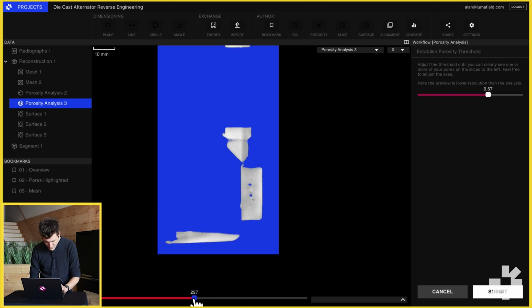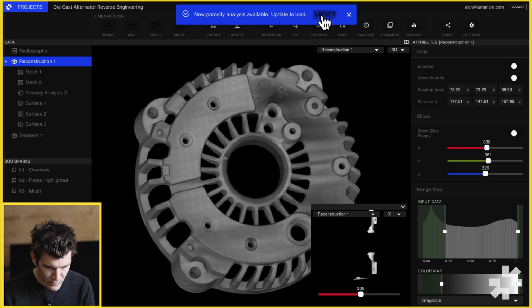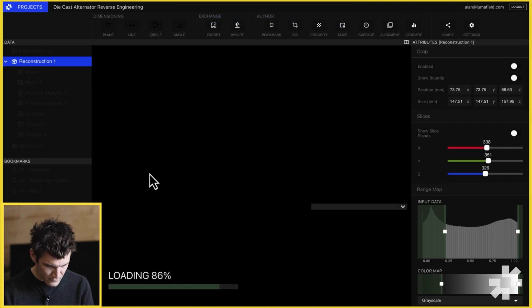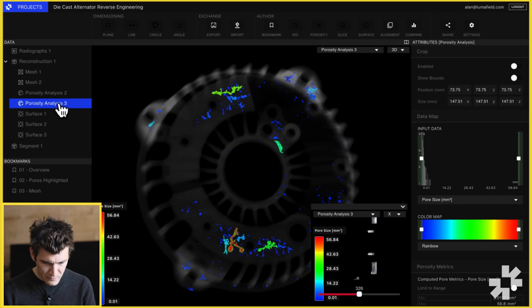Just take a look elsewhere in the casting. You can see that other pores are getting highlighted here. Once we're happy with our segmentation threshold, we can click Submit to send the porosity analysis job to the Lumafield cloud. Once it's finished computing, it'll update automatically in Voyager, and we'll be able to look at the results. So I'm just going to click Update here to load those new porosity results. And now we have our porosity results.